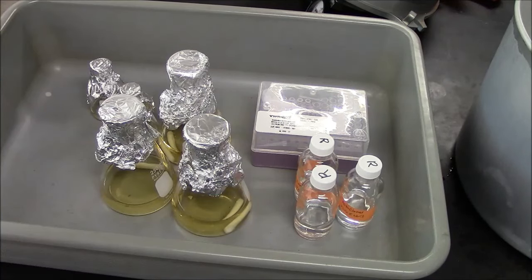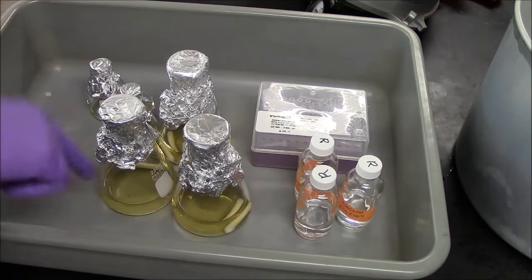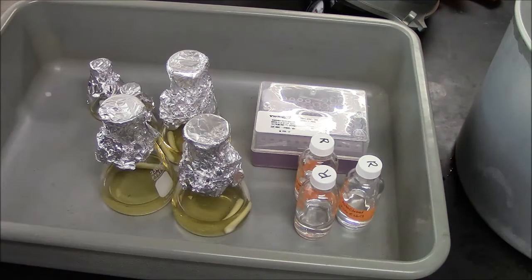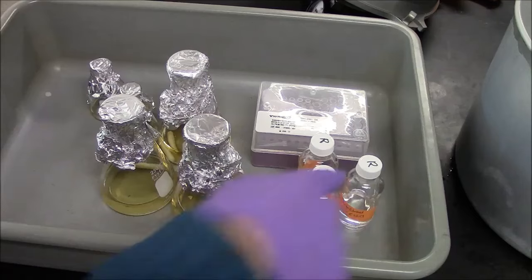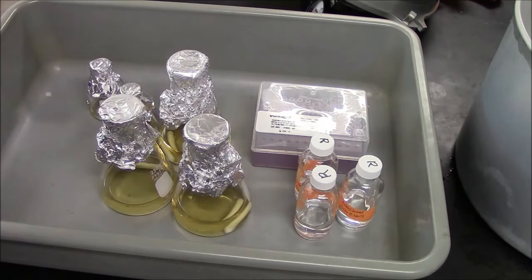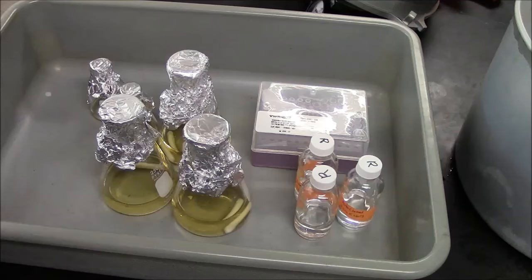These are materials I'm planning to sterilize. I have bacterial broth growth medium here. I have some solutions that I want to be sterile. I have some pipette tips that I will also sterilize.